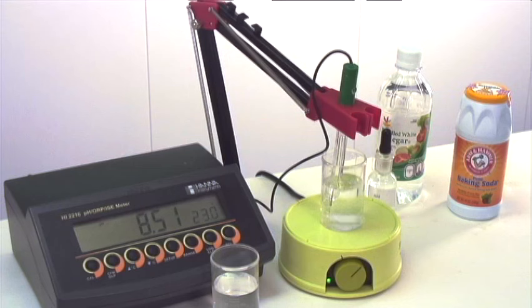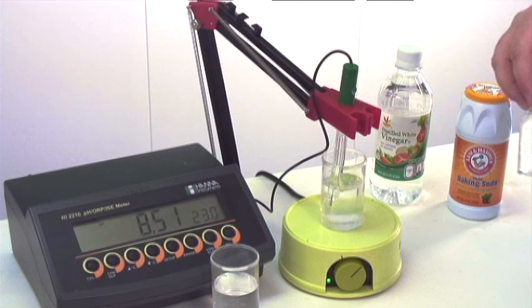This is starting off around a pH of 8.5, and again we're going to slowly add our vinegar and see how quickly we can change the pH.